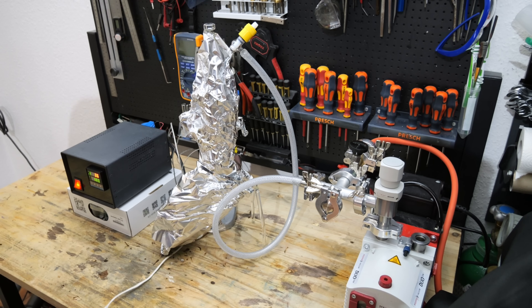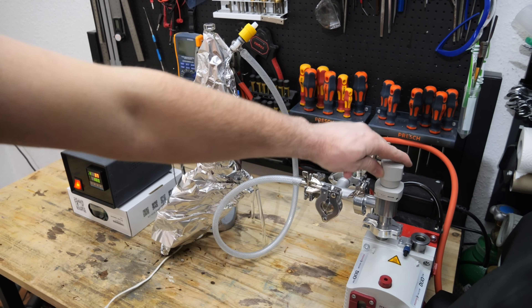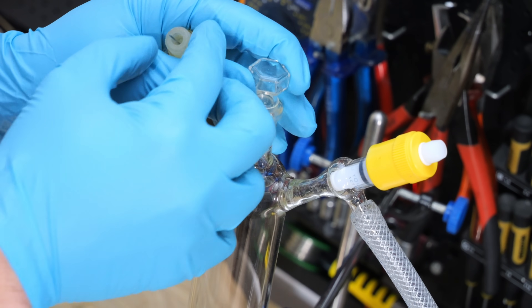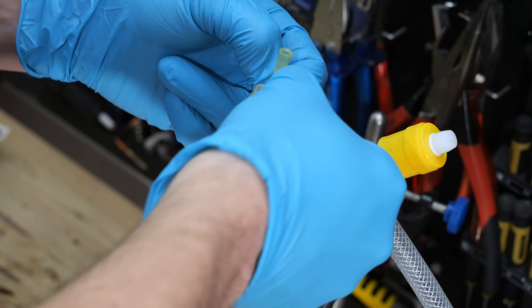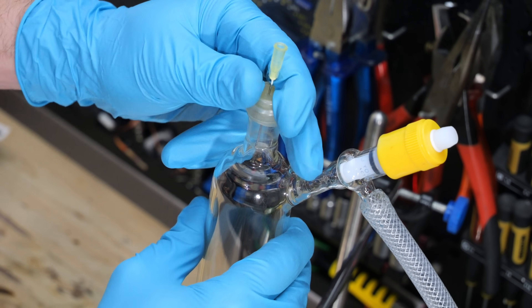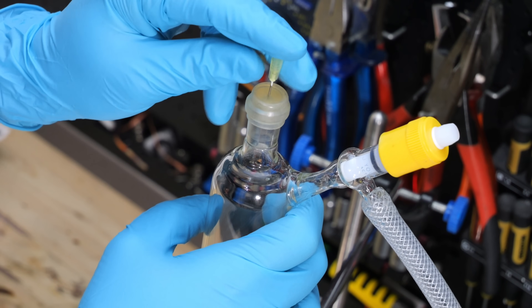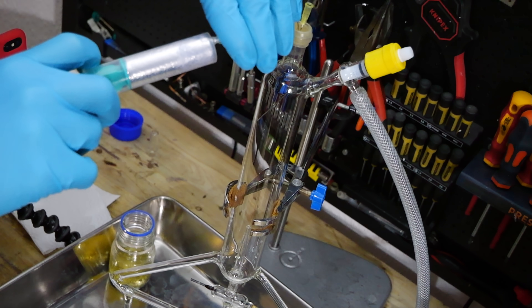Afterward, I will switch off the vacuum pump and let argon gas flow through the fountain to prevent air and moisture from re-entering. By using a rubber septum, I can seal the top of the fountain while still being able to add the metal using a cannula. The additional needle is to allow the escape of argon gas, otherwise pressure would build up inside. With a syringe, a total of 60 milliliters of the sodium-potassium alloy was filled into the fountain.